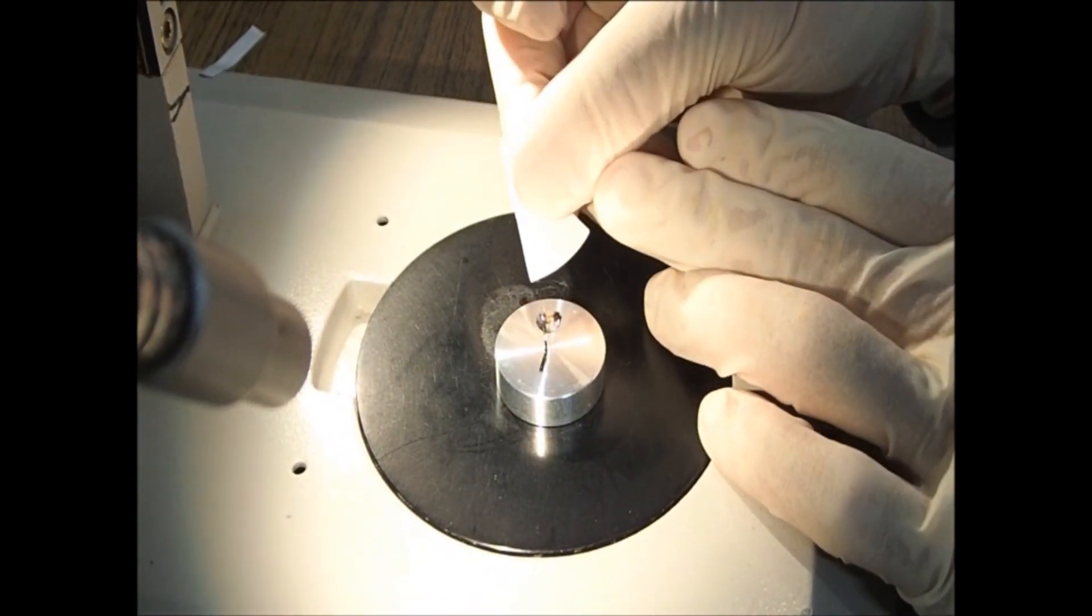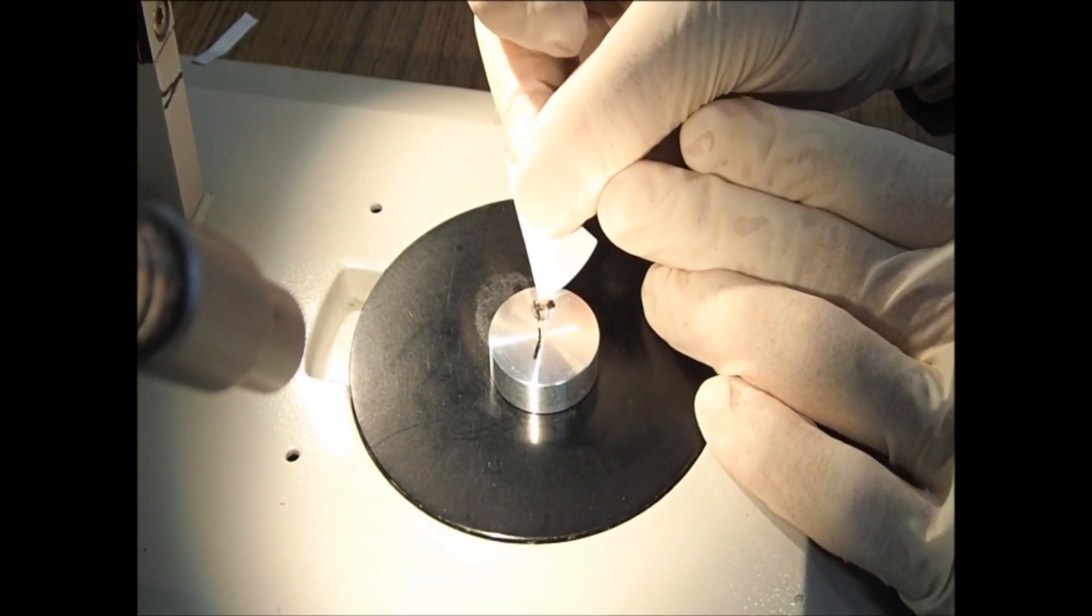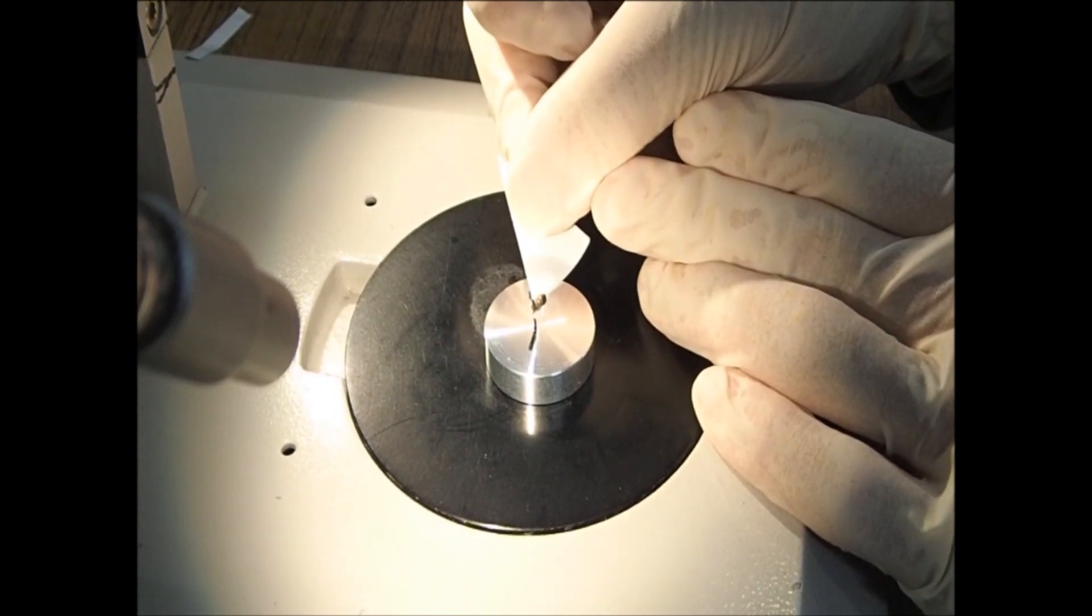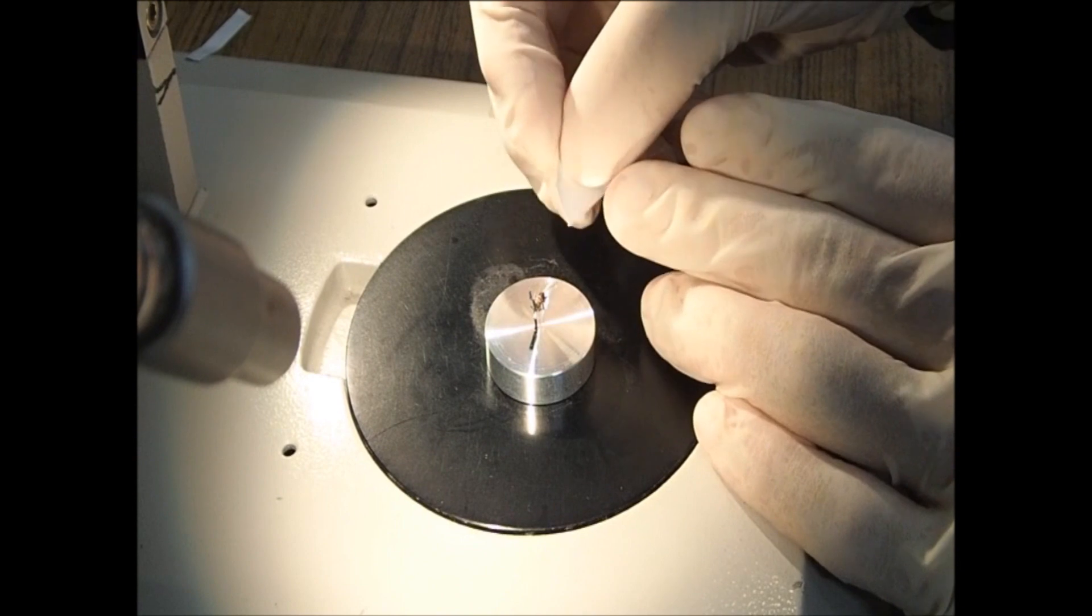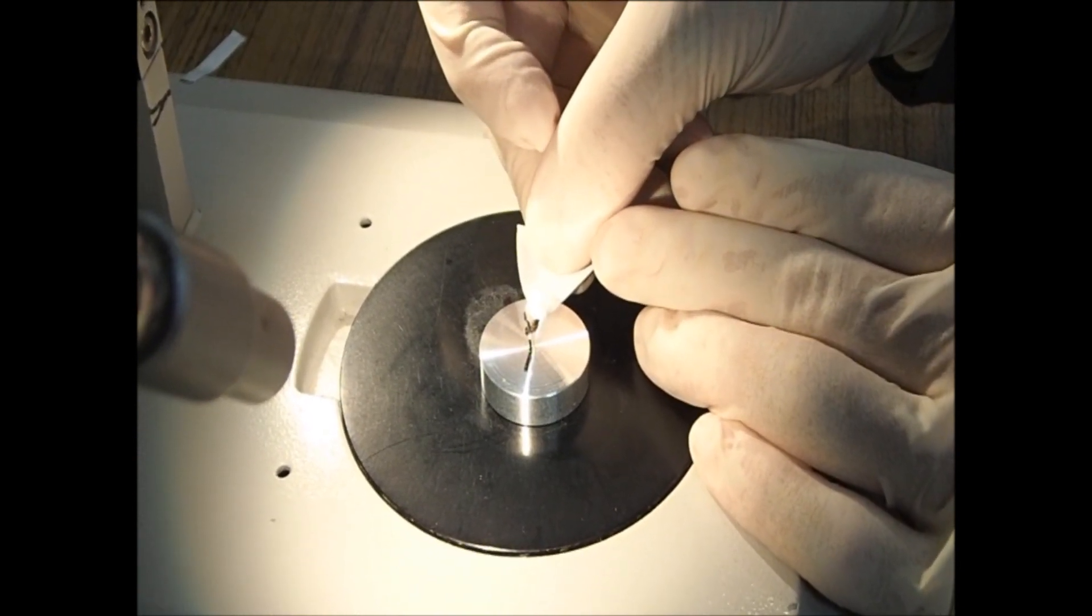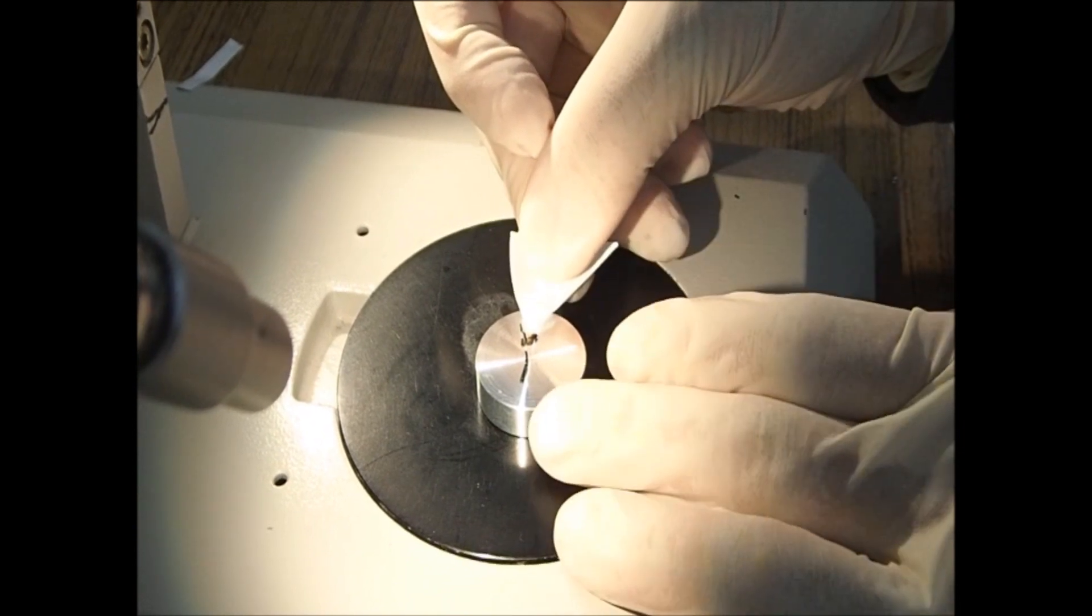Use the filter paper to absorb excess nanosuit solution. It is important to firmly absorb the nanosuit solution with filter paper.